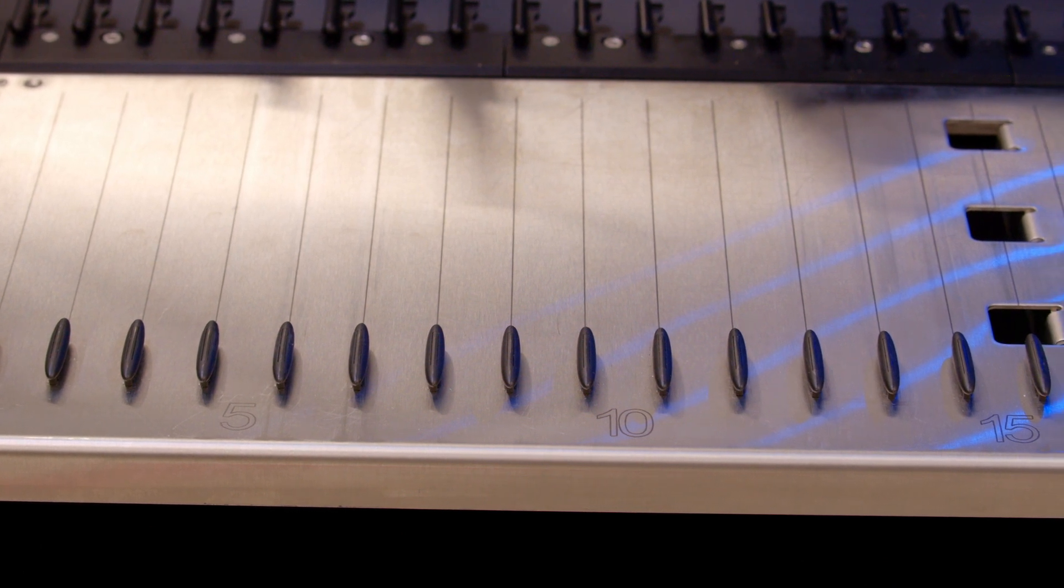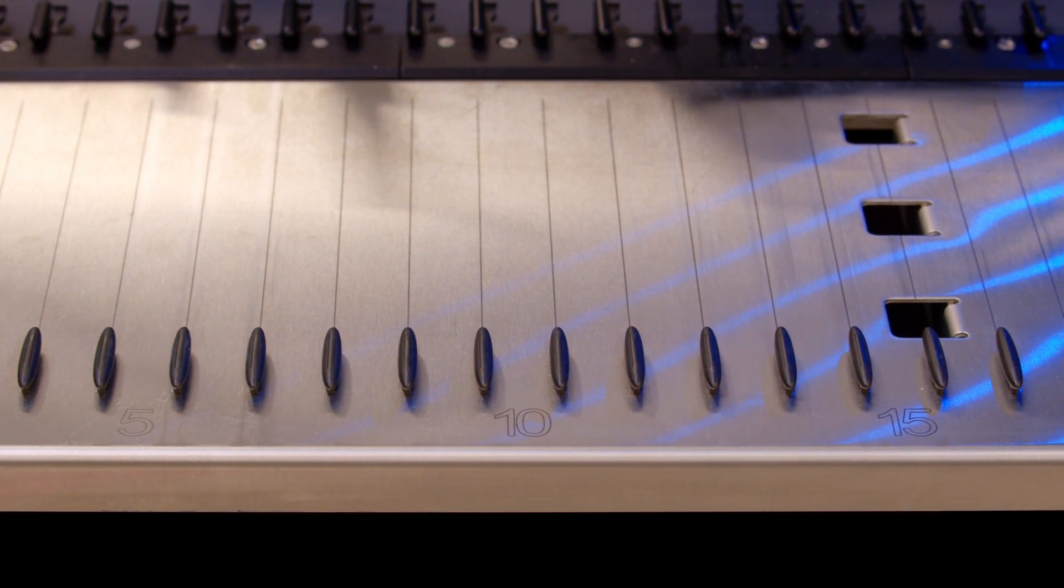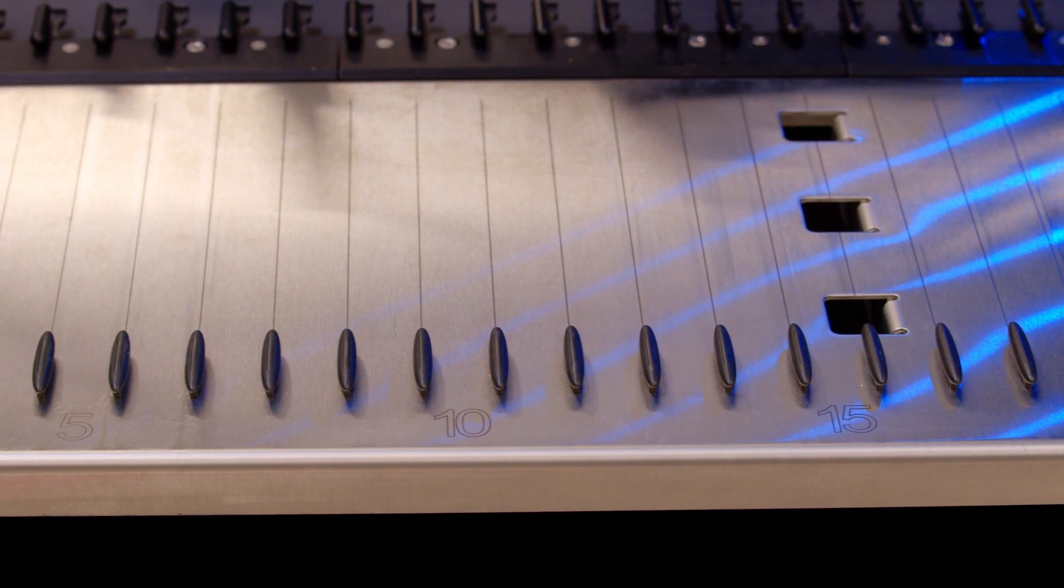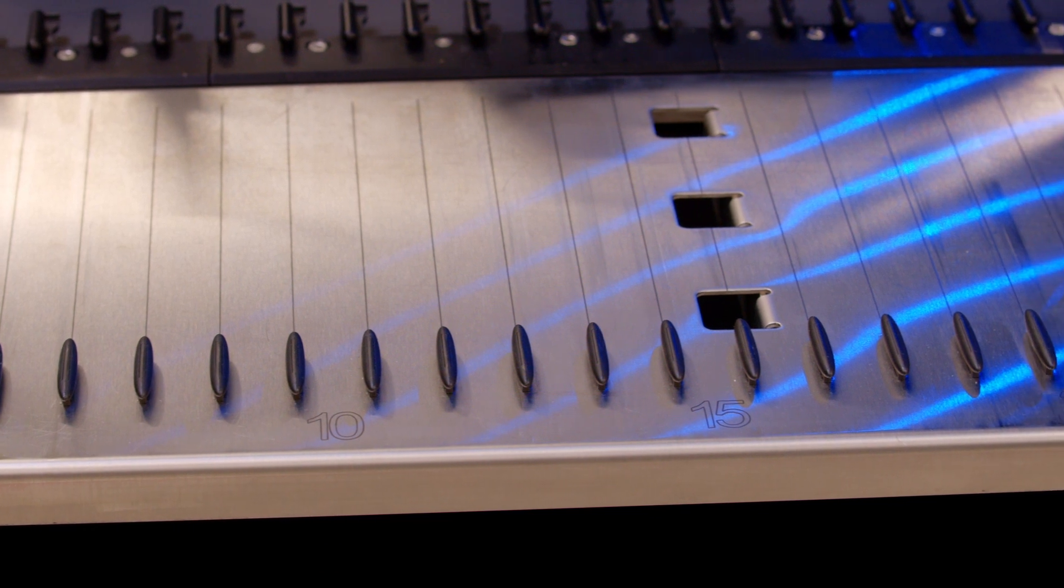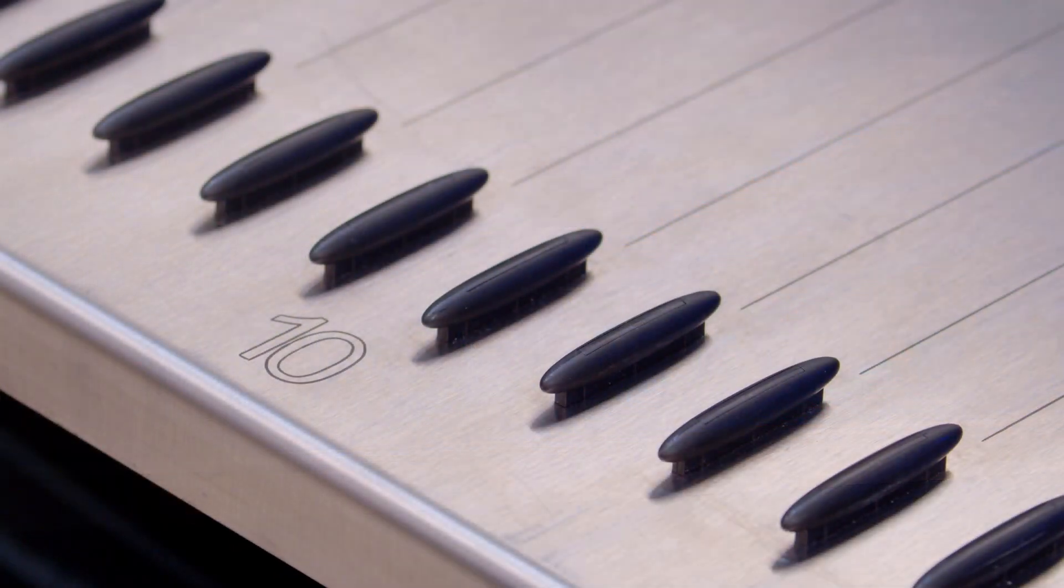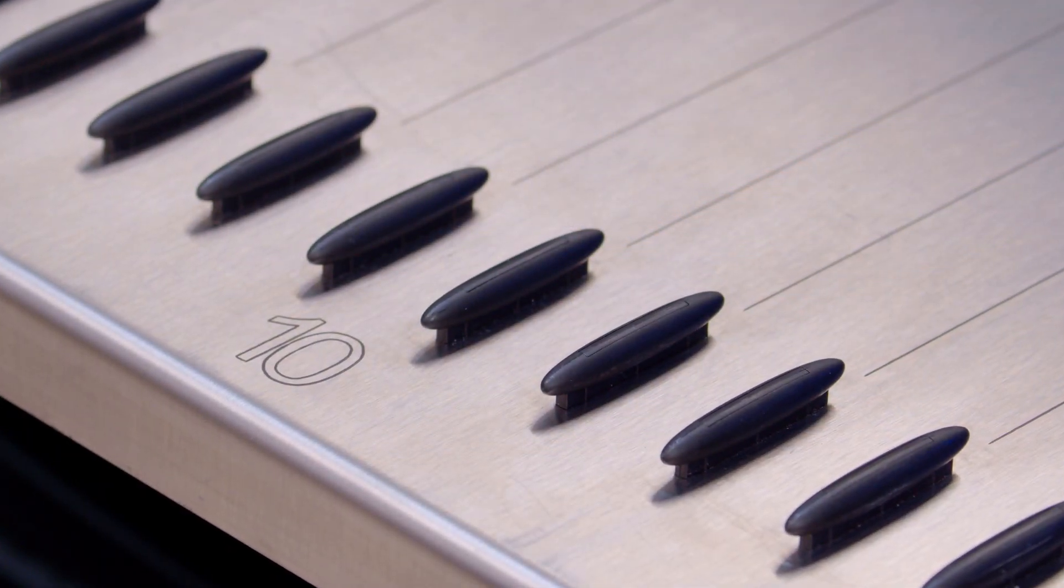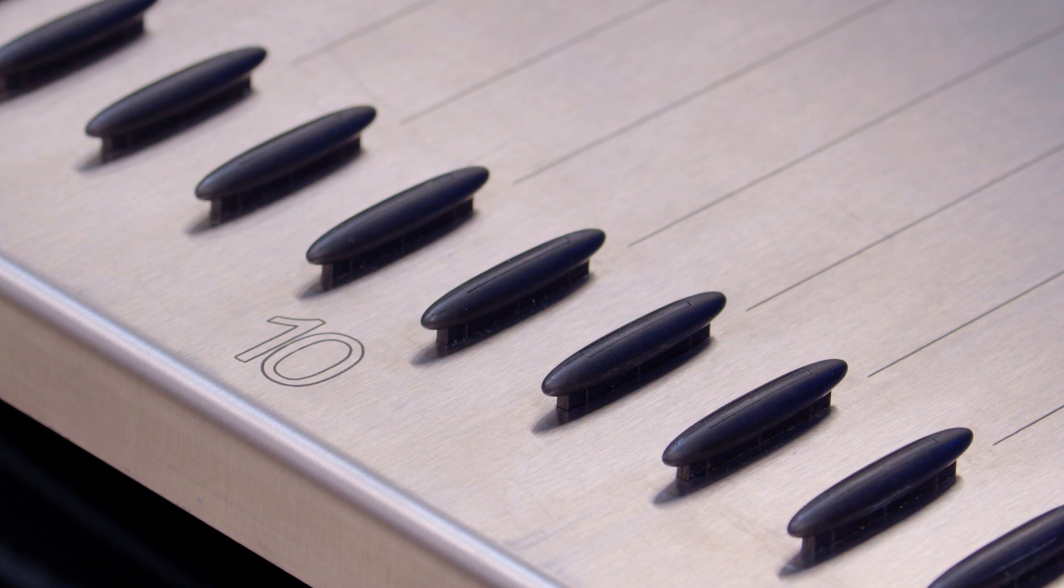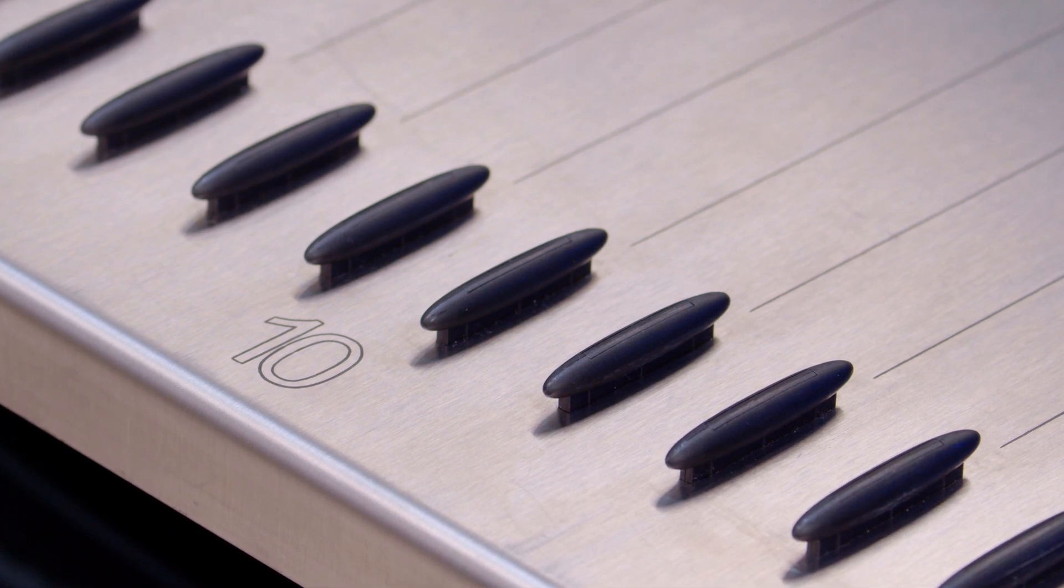The autoload tray is in front of the SP100 and has tracks to guide the carriers as they are moved in and out of the instrument. Slide blocks guide the carriers along the tracks as they move between the work deck and the autoload tray.